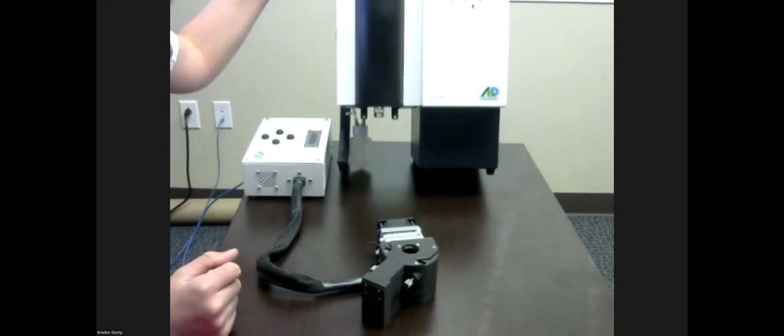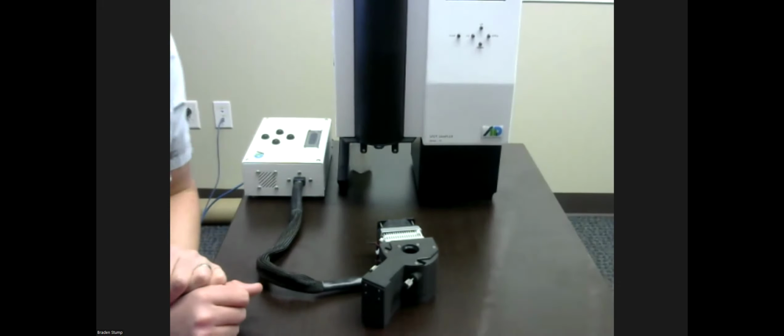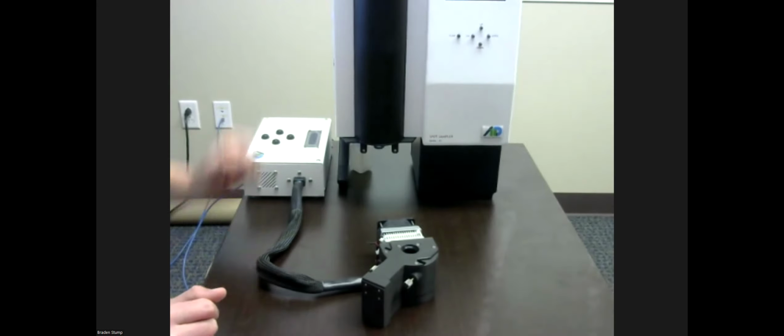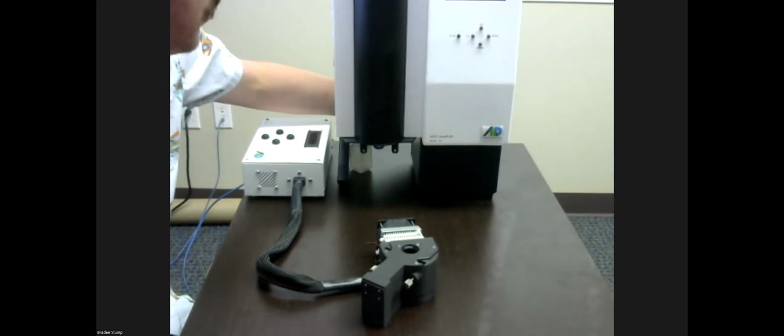So the way that we install this cooling sleeve and actually start a sample with our TLC. As you will see here, we've already got a vial installed with liquid in place. So that is ready to go. This spot sampler recently had its wick wet, recently got down to temperature. So we will get started with that process pretty quickly. It can be a lot faster than usual, which is nice.